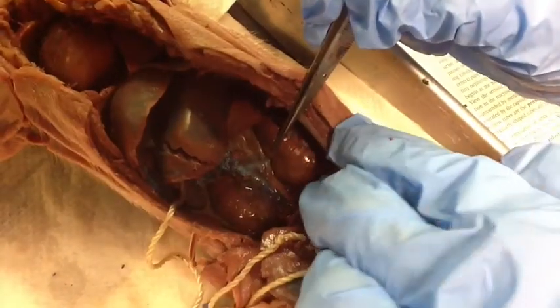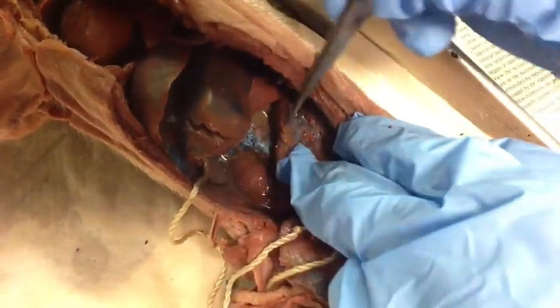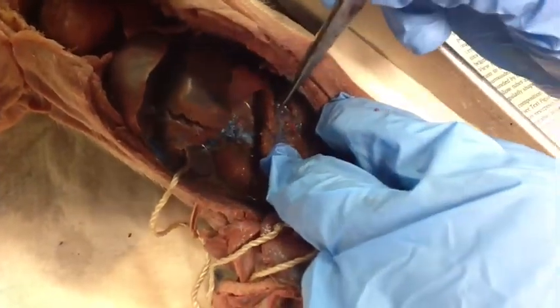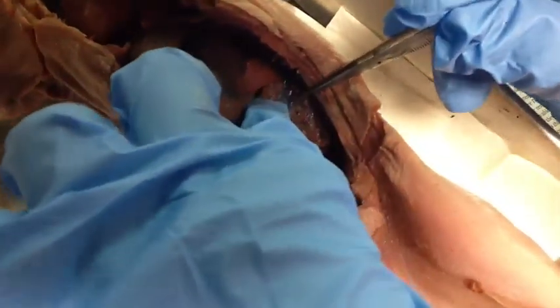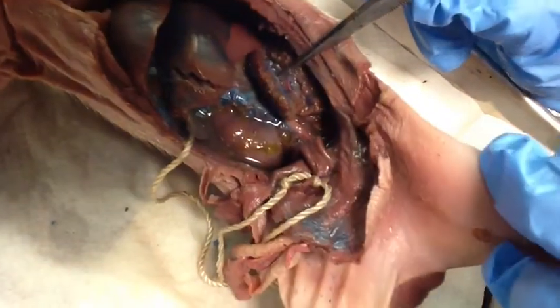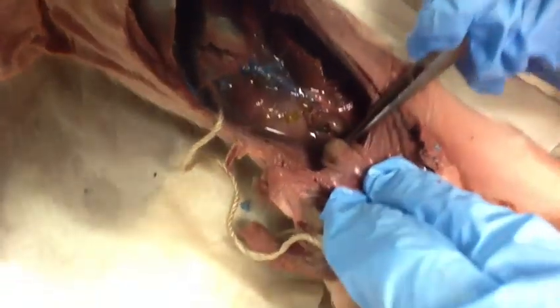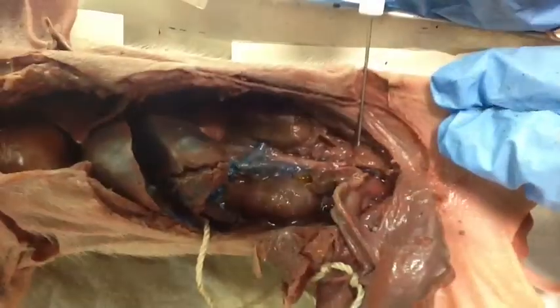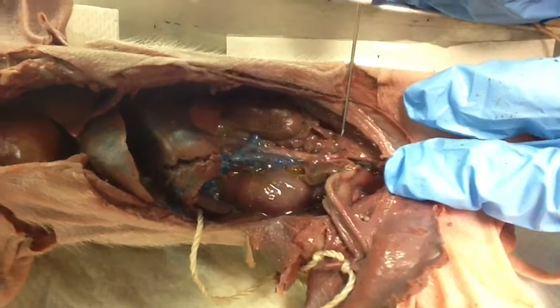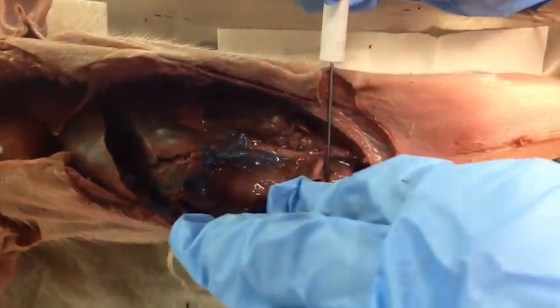Cut it open. Here we see the kidneys. Cut it open so you can see inside, and the outer part of the kidney section is the cortex. And here we see the inner medulla, the renal arteries and veins, and then we follow the ureter down to the bladder, which will excrete urine. Here we have the testes, which is connected to the vas deferens, which connects it to the urethra and the bladder.